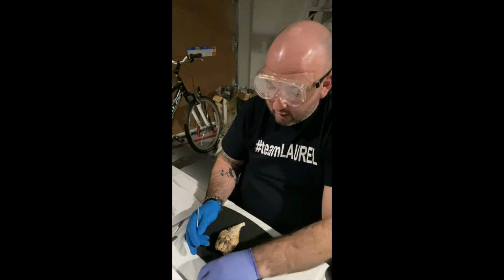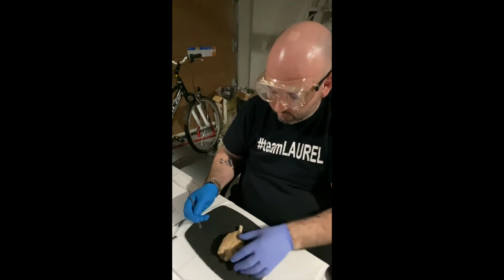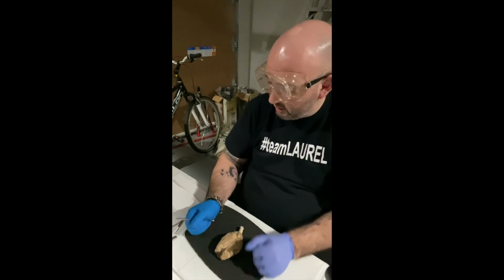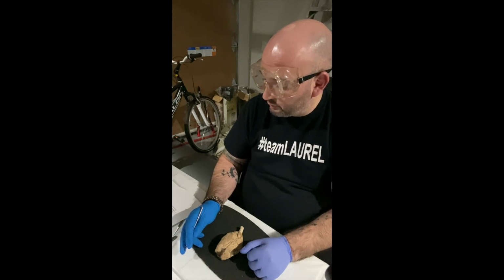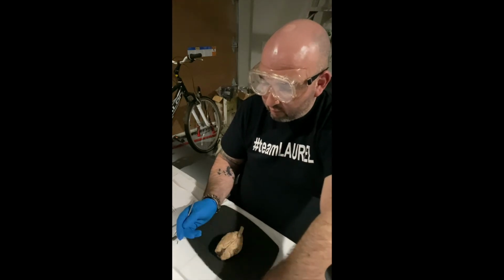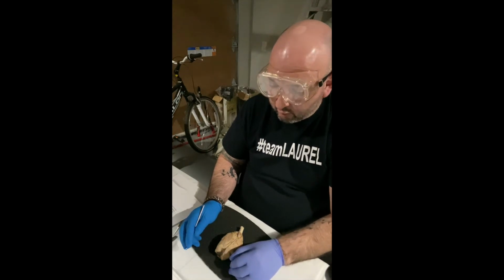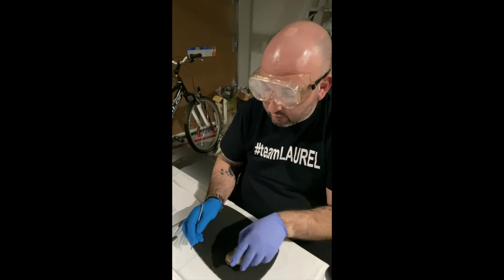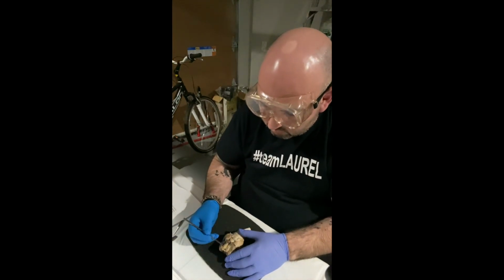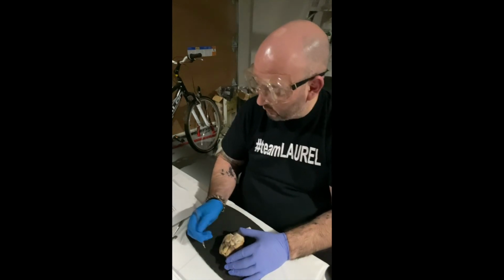Next up are the occipital lobes. And the occipital lobes are here and here, kind of on the back of the brain. The occipital lobes are the visual processing center of the brain. Now we're going to talk about the olfactory bulb. Now, olfactory stands for the sense of smell. And the olfactory bulb is here. This is the olfactory bulb on both hemispheres of the brain.